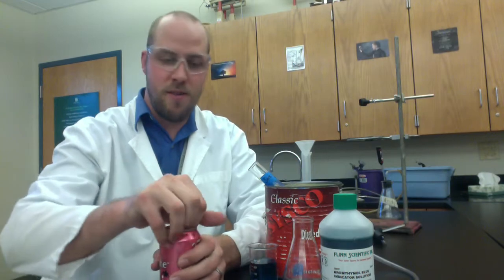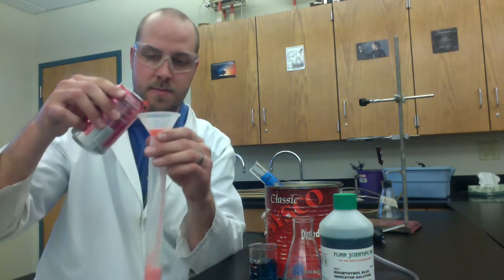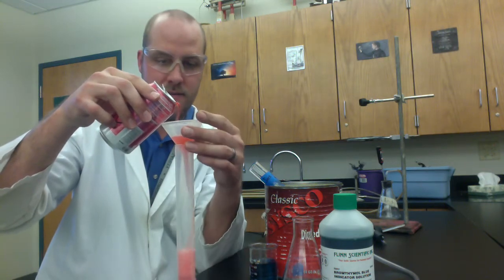You're going to start off by opening up yourself a nice refreshy. You'll have an option of a strawberry, an orange, or a grape flavor, and it's a good idea to always measure your volumes on a level surface.